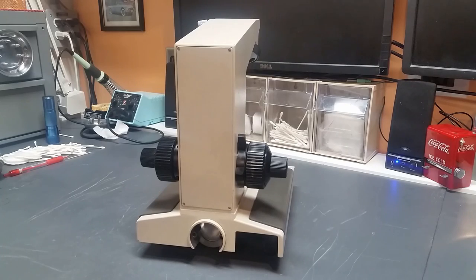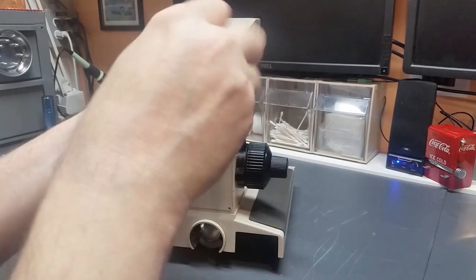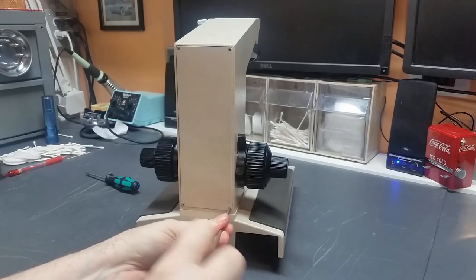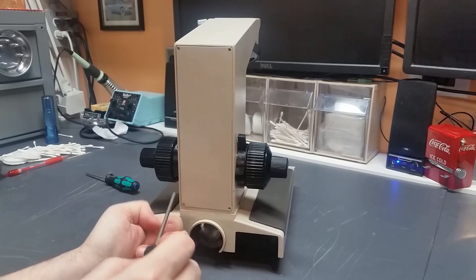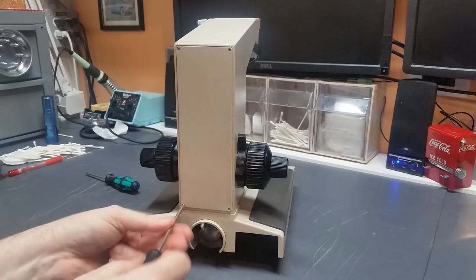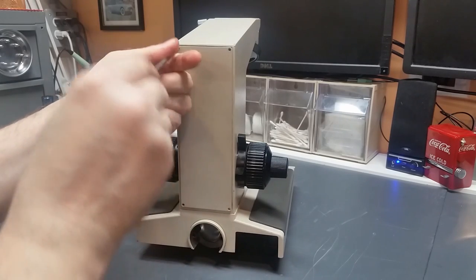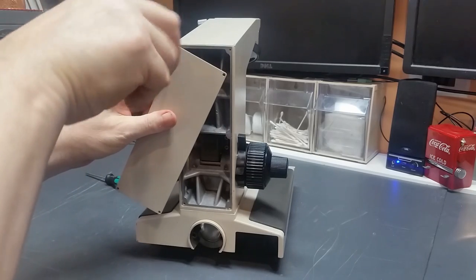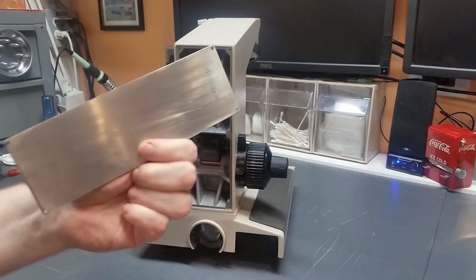Okay, first step is to remove the back cover. This will give us access to the gearbox and the internal parts, and you can't do service without taking off this cover. There's four tiny 2mm M2 metric screws that hold the cover in place. And as always, I suggest you use a properly sized JIS screwdriver for these screws. Otherwise, bad things can and will happen. So this is the rear cover.